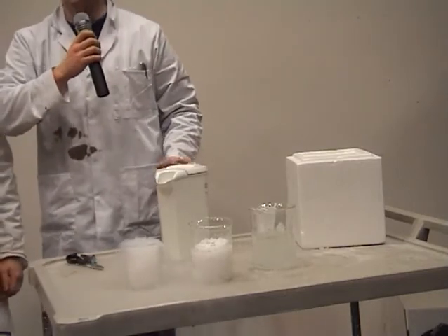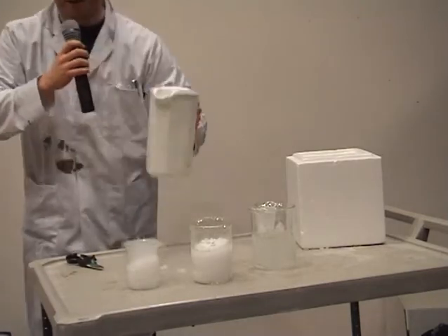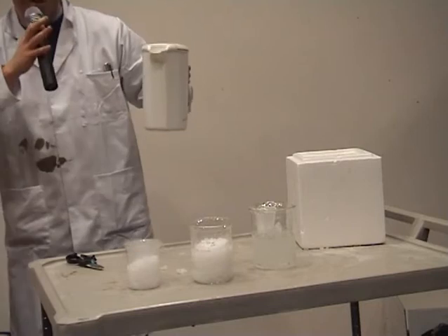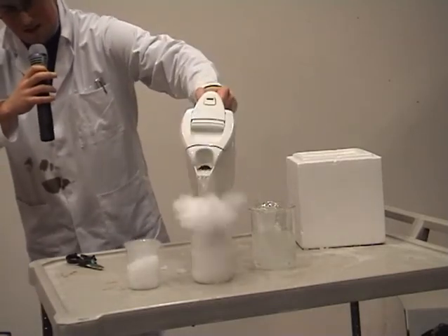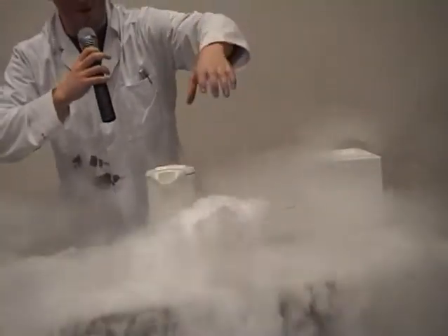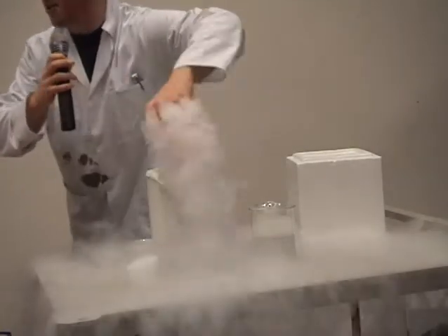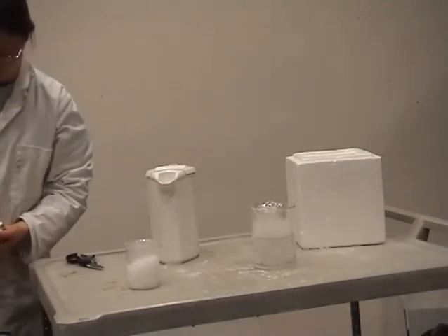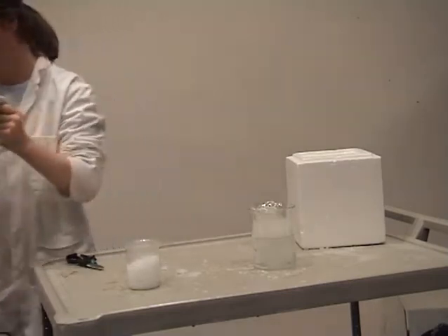But again, that's another very boring reaction. We don't like that at all. We want good, fast reactions. So we'll try some hot water because the boiling point of CO2 is so low that the boiling water should make it go very quickly. Yeah, we like that sort of reaction. A good, fast reaction that spreads a lot of the chemicals everywhere. Right, I'm just going to put this out to the side now and let that build up. We'll come back to that later on.